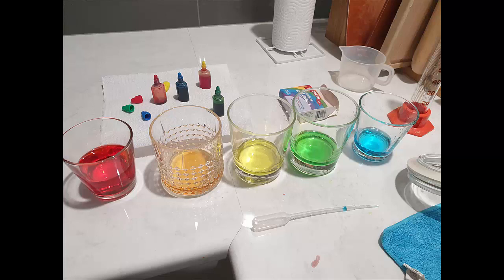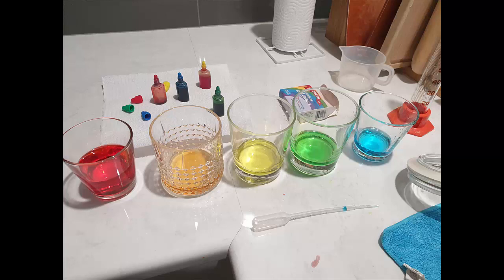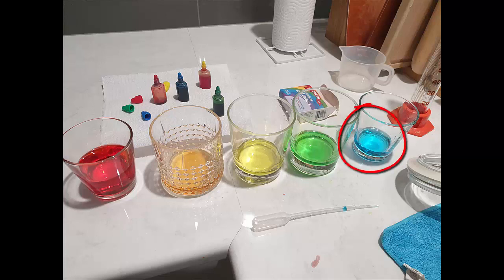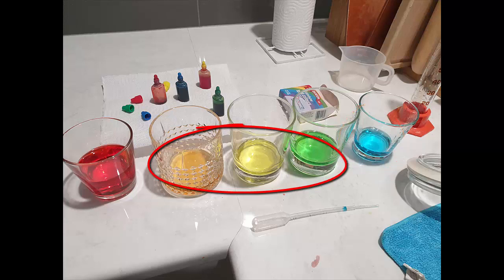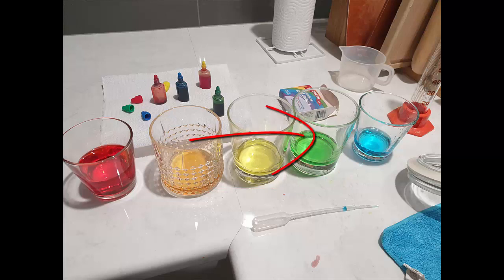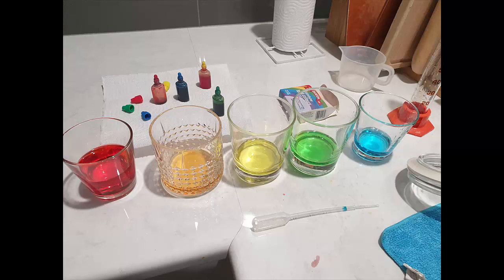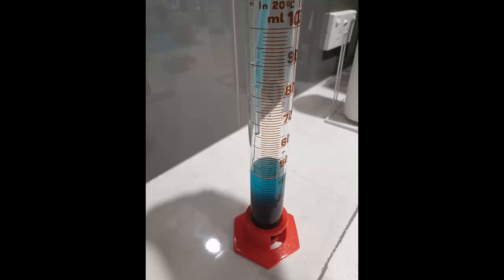It was a little bit random because if I added too much salt to the orange one and it didn't dissolve, all those layers would end up the same density — they'd all have a saturated salt solution. So if I added water to any of them, I had to add the same amount to all of them. The middle layers need to be different — this one needs just a little bit of salt, the next slightly more, then slightly more, then the most you can get. The key trick is to layer them very gently using a Pasteur pipette so it falls in drop by drop and slides down the side, placed as close to the bottom as possible to avoid currents.